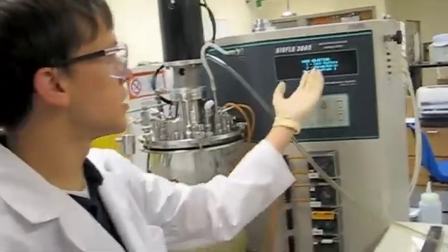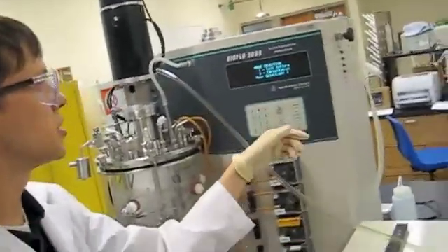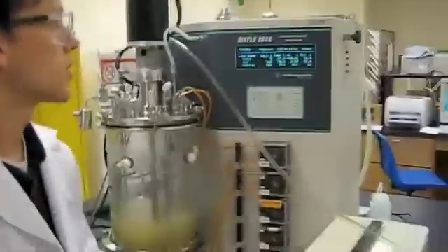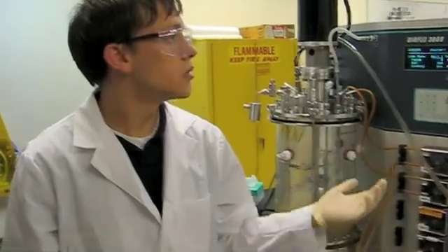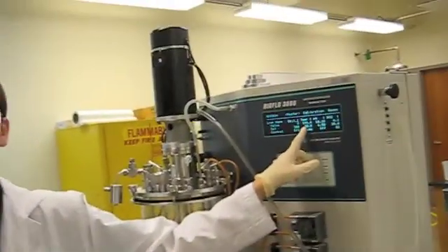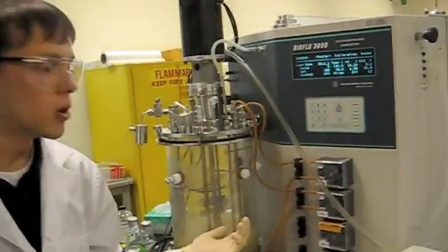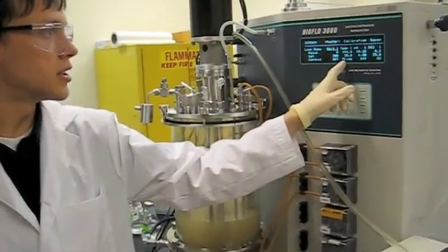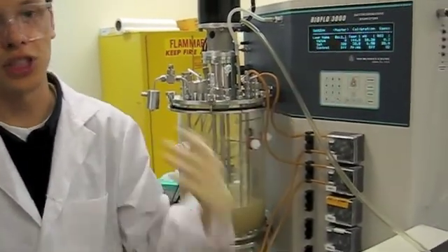Okay, so we're going to select fermentation, setting number two. And here are the controls. So once we turn our machine on, we're going to set our temperature to what we want to grow our yeast at, which is 30 for us. And we are going to turn on prime to let the machine warm up.